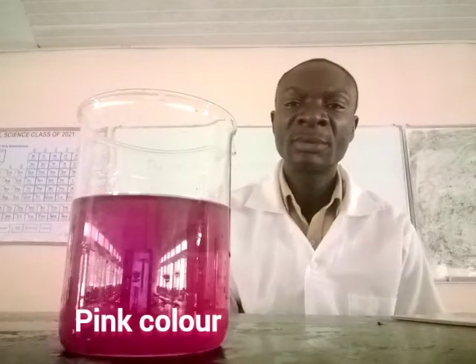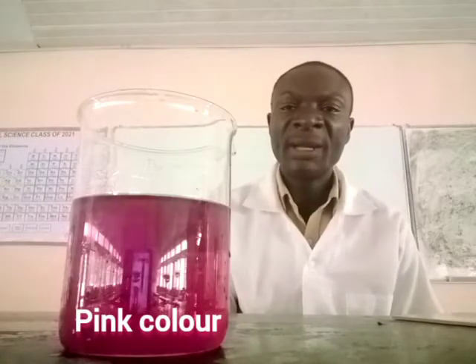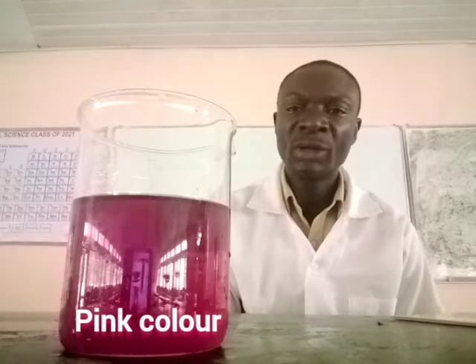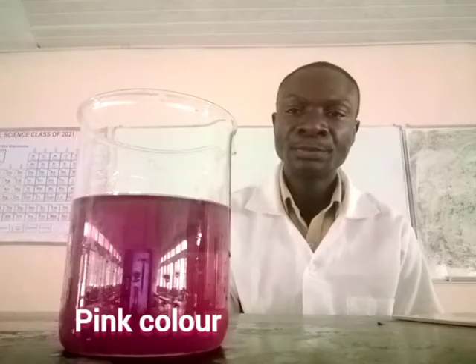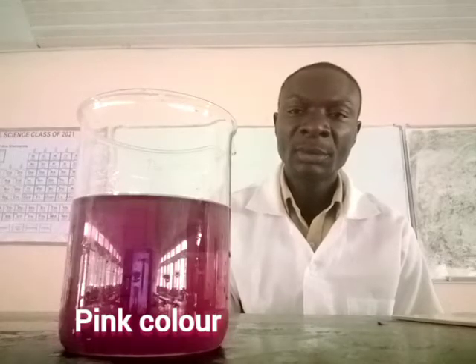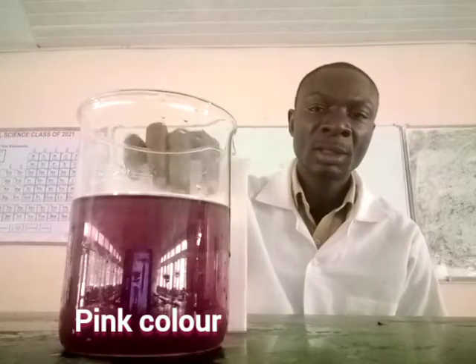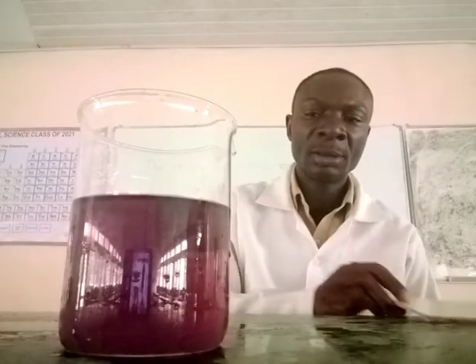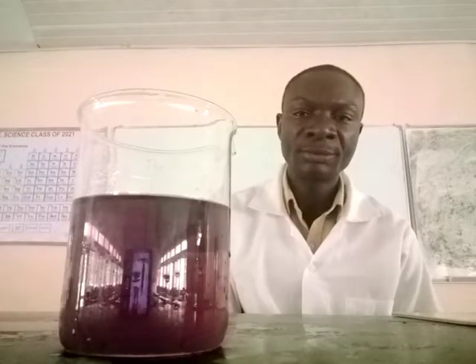Now, it's undergoing the reduction process from Mn7 plus to Mn6 plus. Okay, you can observe the change in color.